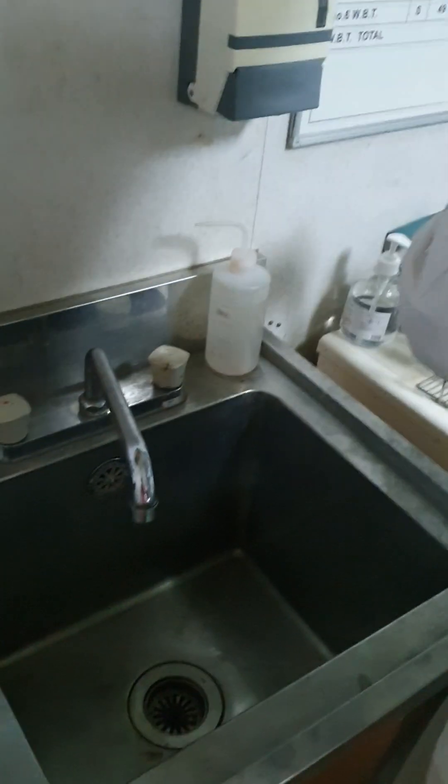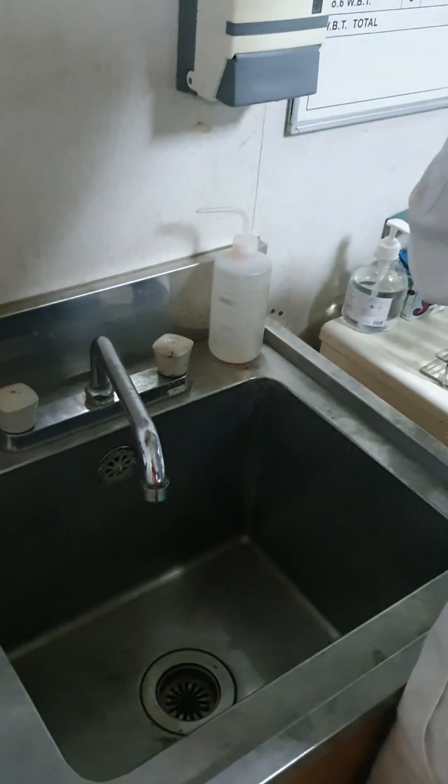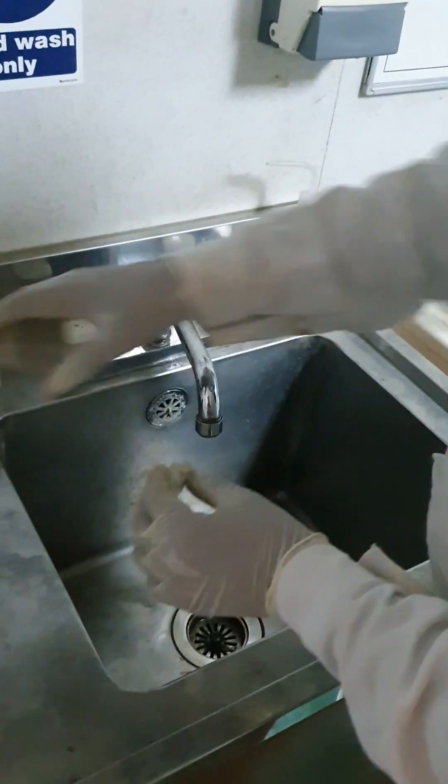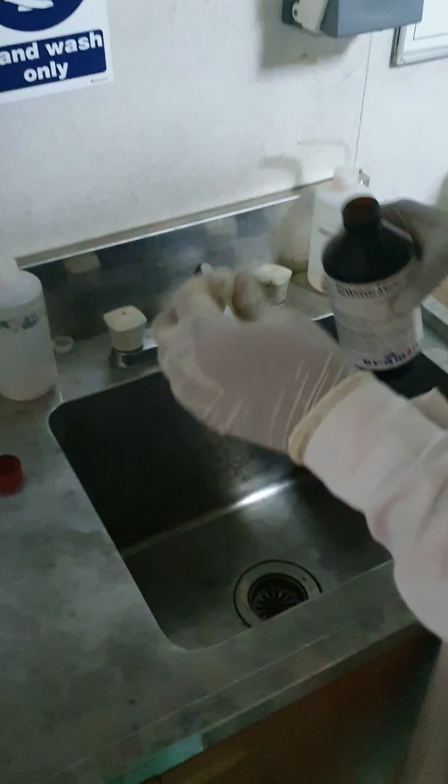This is almost expired one, that's why initially color will not be so much, I mean, red type.